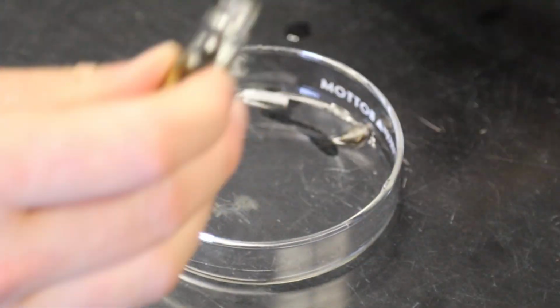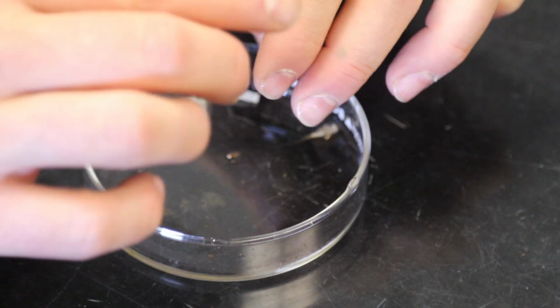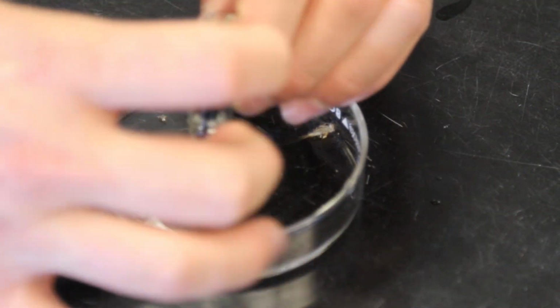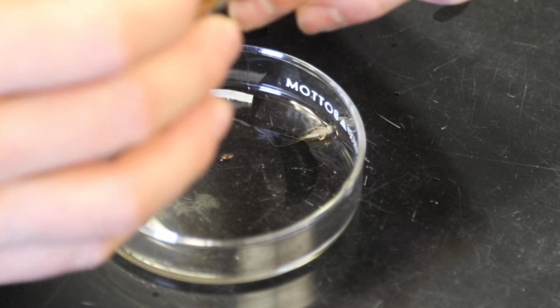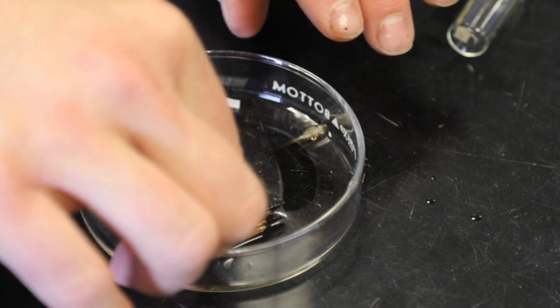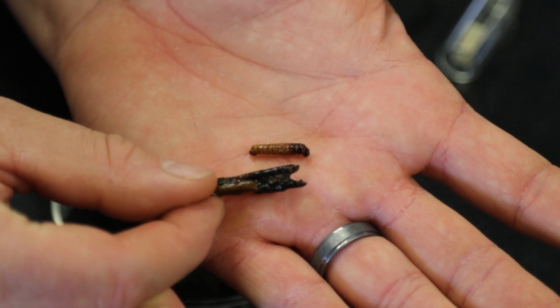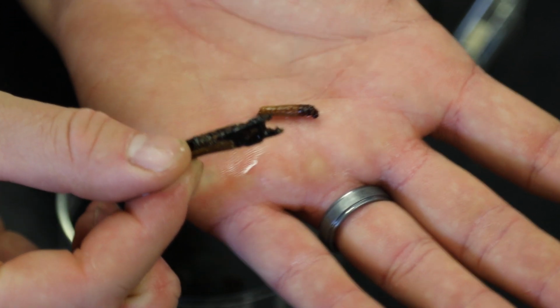Now Trichoptera are caddisflies. They make cases. And I've actually got some cases in here, and it's probably going to be tricky to get out. But yeah, it's probably going to be tough to get out. This is a Pycnopsyche. You don't need to know that, but there we are. It looks like a little worm. Can you see that? There he is. He's a little worm-like guy. And here's his case that he comes in. So this is the larval version of that. Again, no adult for this one.